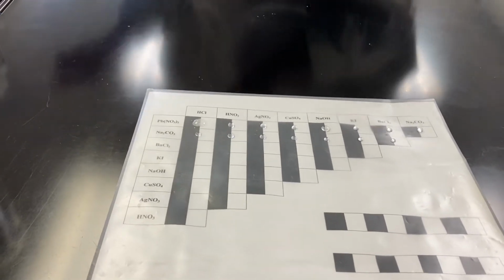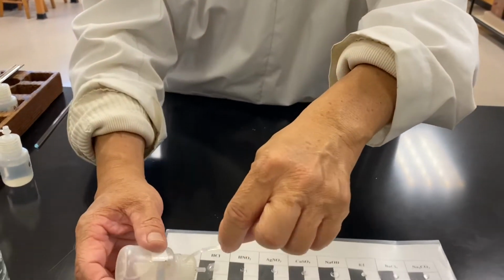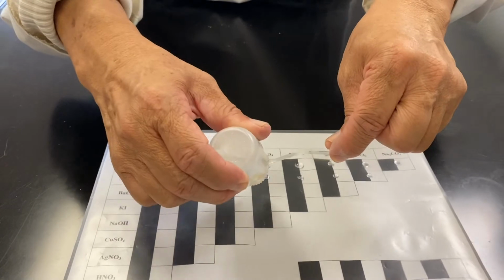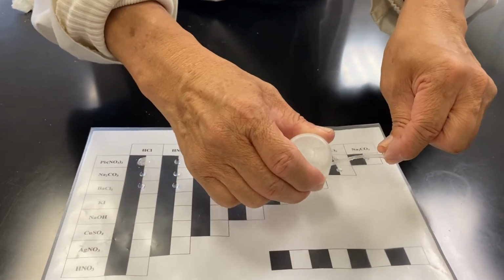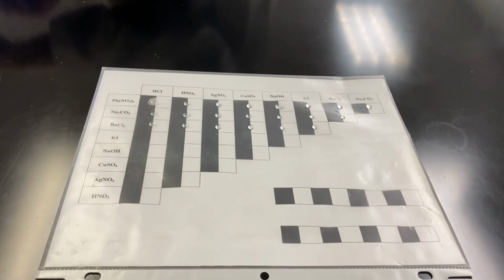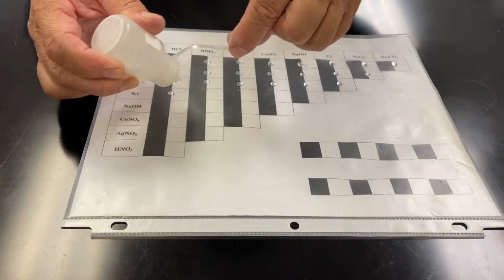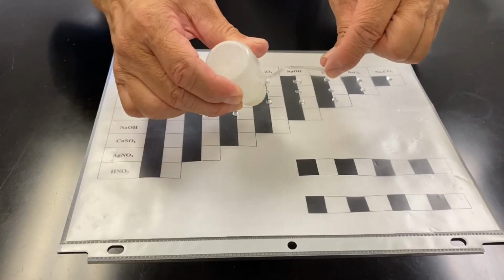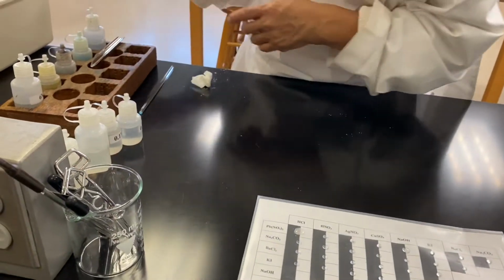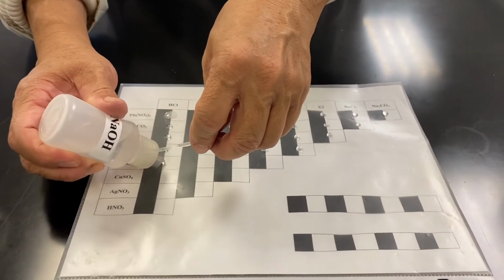Continue through the remainder of the boxes and record observations after mixing. During the mixing of the 2 different chemicals, you have to observe the 3 visual indicators of a chemical reaction: change in color, formation of a precipitate, and/or formation of effervescence. While some of the reactions may be very fast, some on the other hand may take longer to react. So be patient.